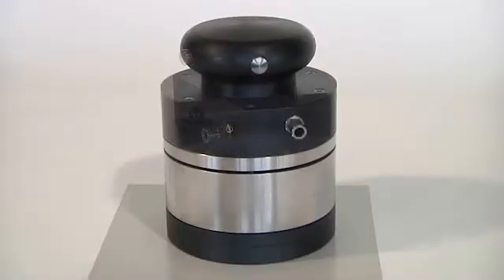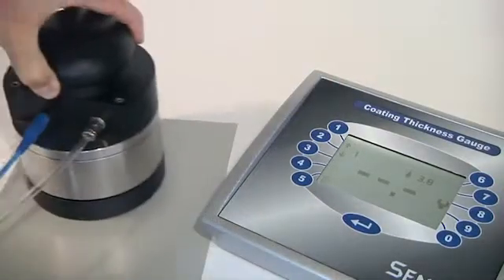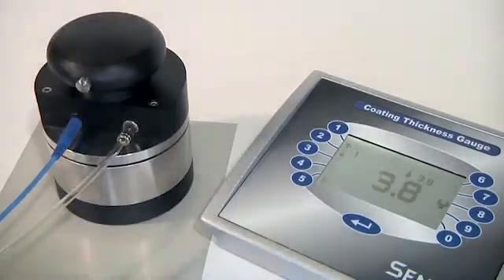The hover probe is an ideal way to measure flat sheets. Its built-in weight applies a consistent pressure to the probe, which results in very repeatable readings.